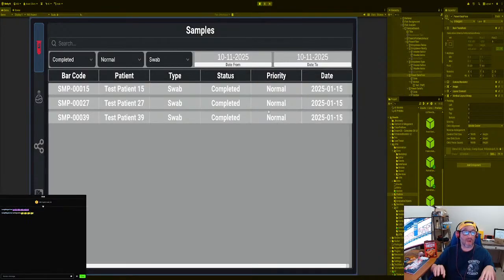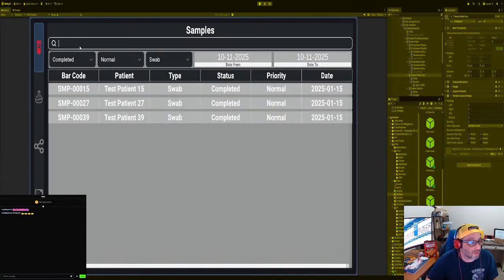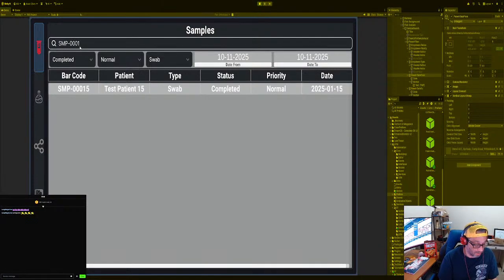Great. Simple. Great. Now we need to take this and add it to the sample types just for the screen, right? The sample types, and then what's left to do? We have to do a search for this too, right? So we have to do a search on the test patient, SMP dash 0001. There we go. It's working. So now we know that that search bar is working as well. All right. Got it? We got it.